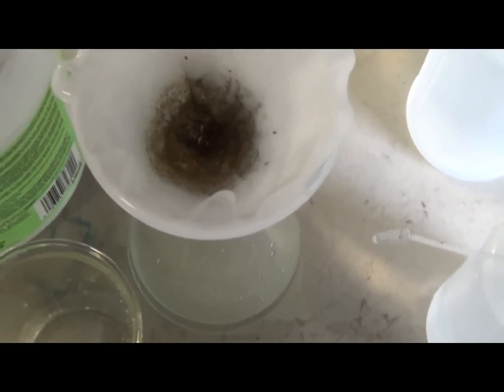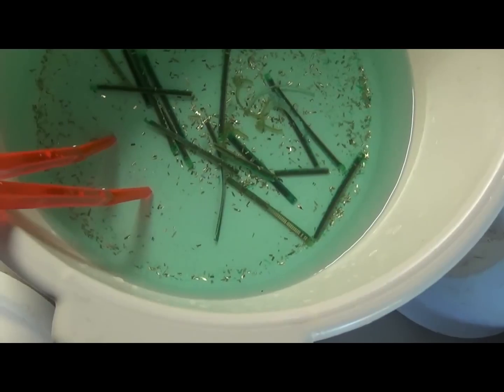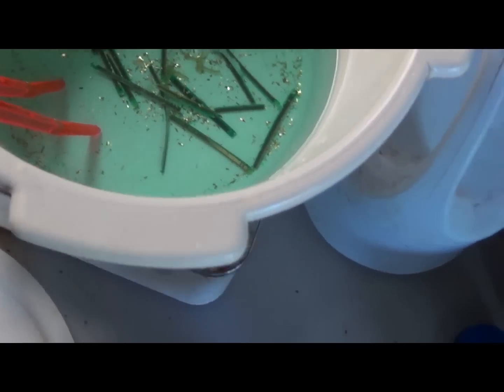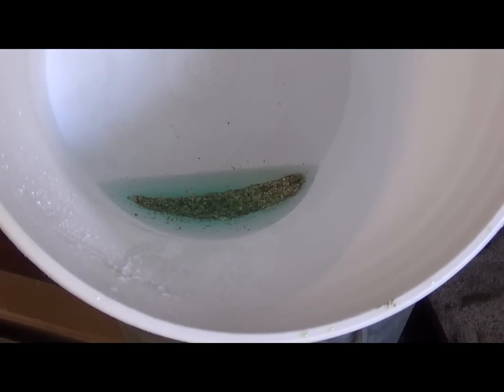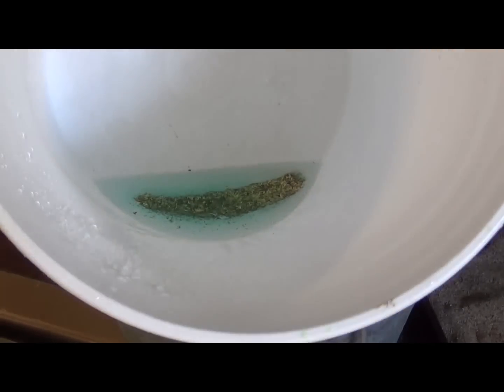You might find little bits of black powder in there — that could be gold as well. While you're filtering, if you want to remove chunks of fingers, that's fine, but don't try to remove too much because the refining process will remove everything else and you don't want to get rid of gold you need. Take your spray bottle and make sure you really get the edges of the bucket — make sure there's no gold stuck anywhere. You can use as much water as you want here because it's not diluting the AP; it's going into a separate bucket. Then pour that through the filter.